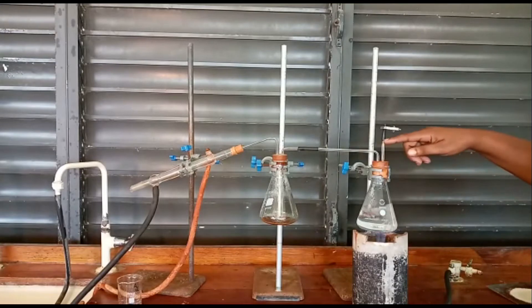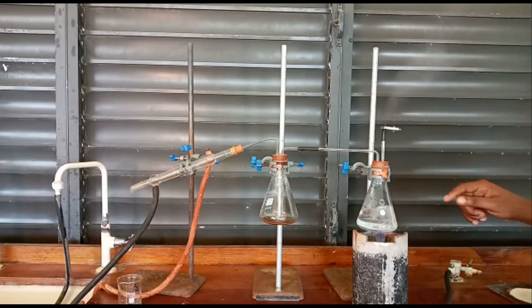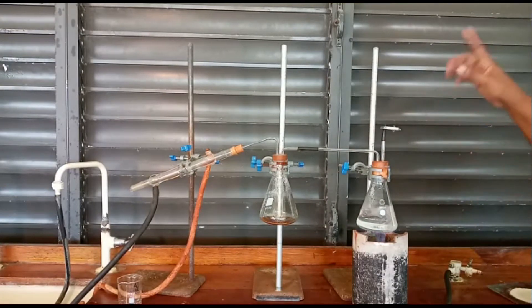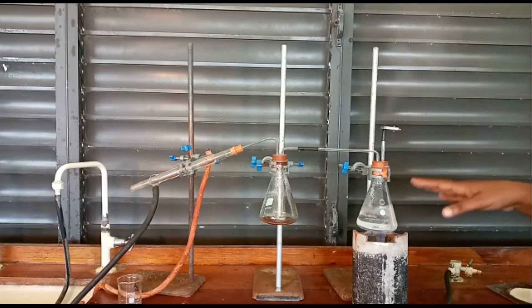Note that we have a vent allowing excess steam to exit so that we don't have a buildup of pressure.